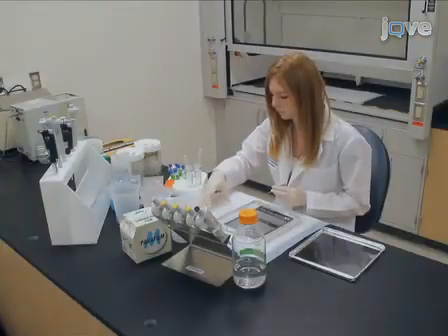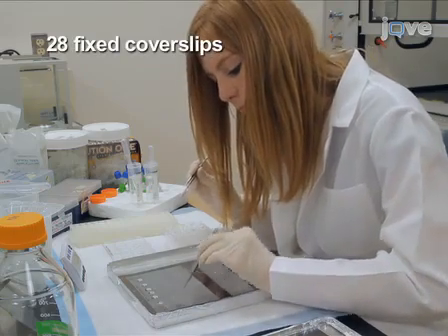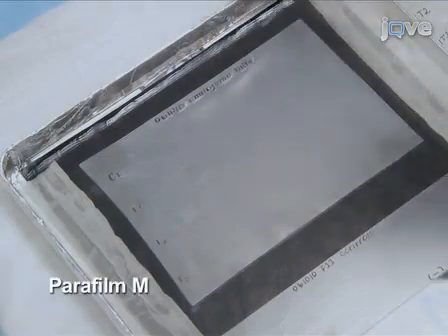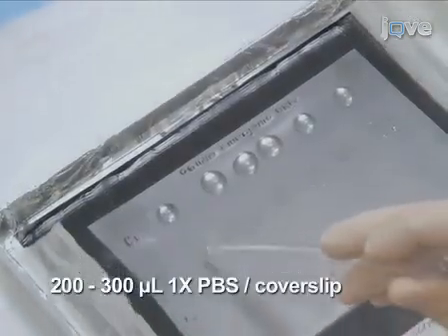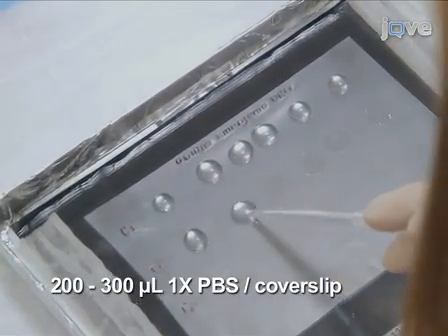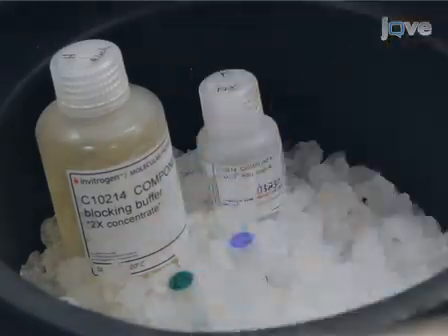Prepare a humid chamber as described in the accompanying text. Use fine-tipped forceps to transfer fixed cover slips, including positive and negative EDU controls, to sheets of hydrophobic parafilm inside the humid chamber. Reapply 200 to 300 microliters of 1x PBS to cover the surface of each cover slip. Prepare the Click-iT assay kit as described in the text and the manufacturer's instructions.